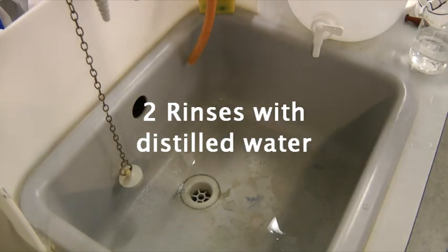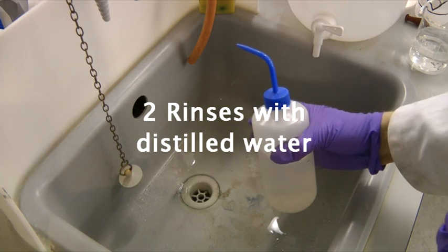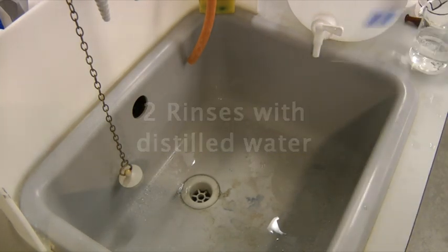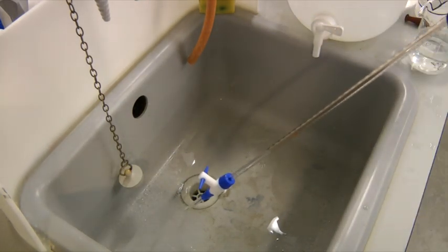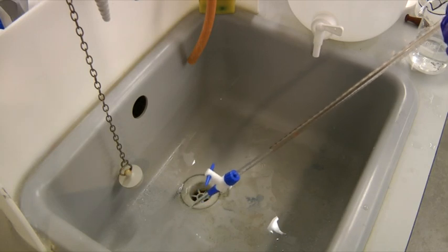Then, we need to rinse the burette twice with distilled water. In this case, the distilled water is being dispensed from a wash bottle, but again the precise instructions may vary from classroom to classroom.